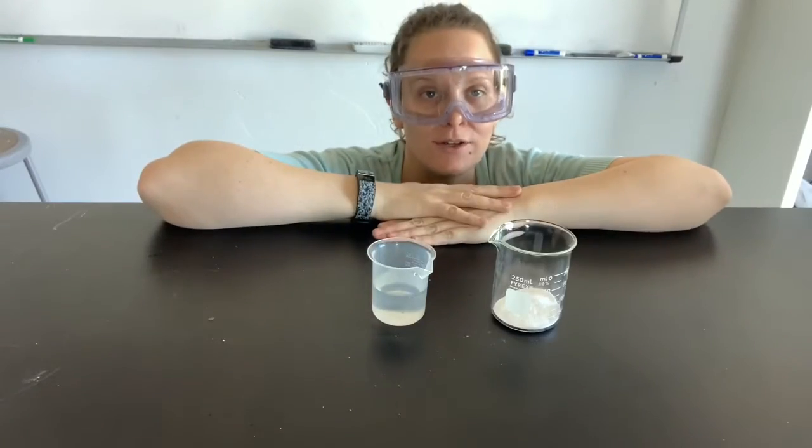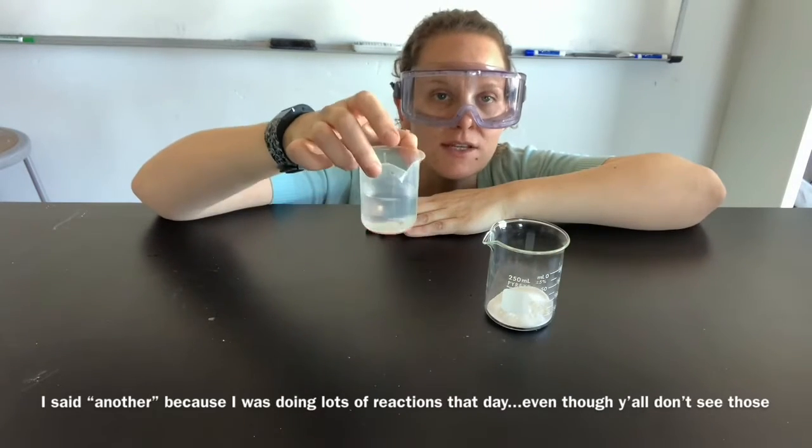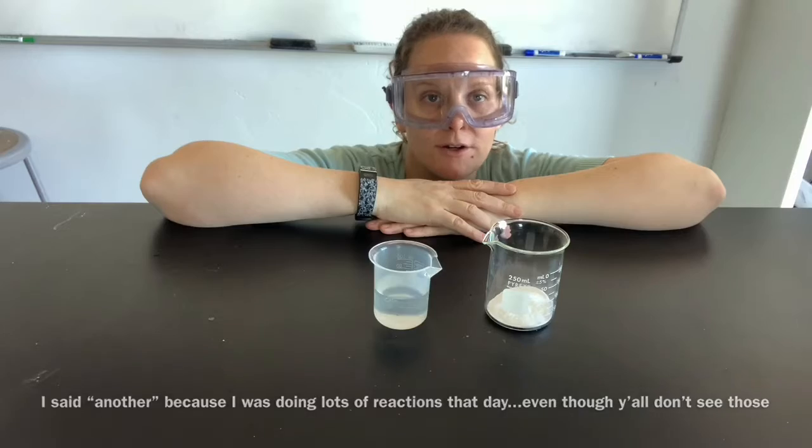I'm going to do another fun reaction. Here I have sodium bicarbonate, and here I have dilute acetic acid. Dilute meaning it's mixed with water.